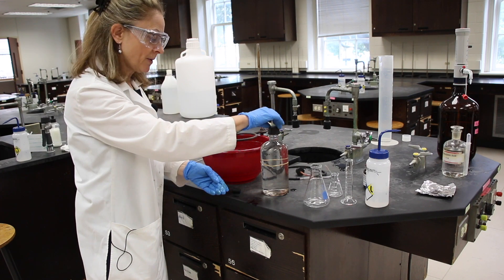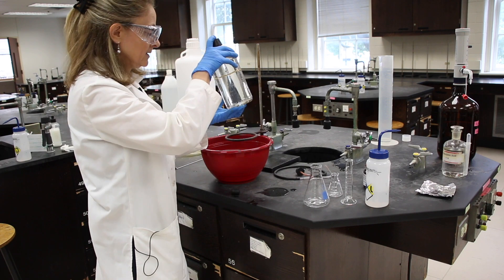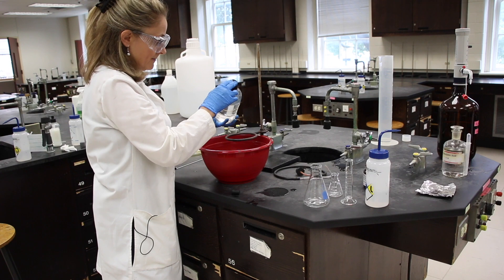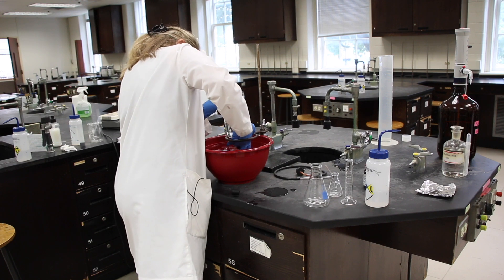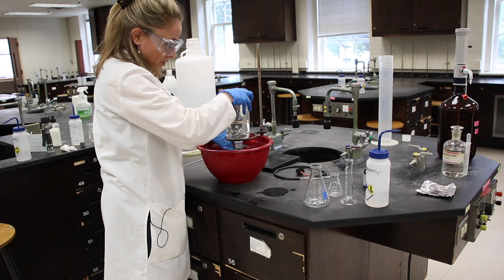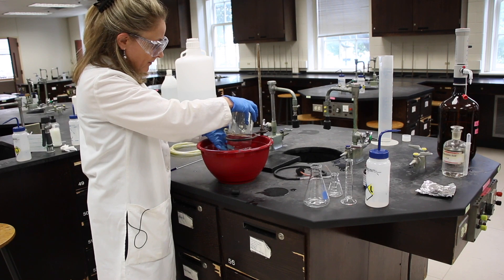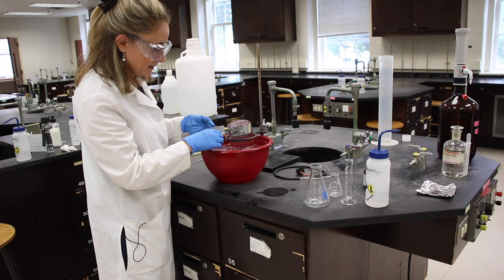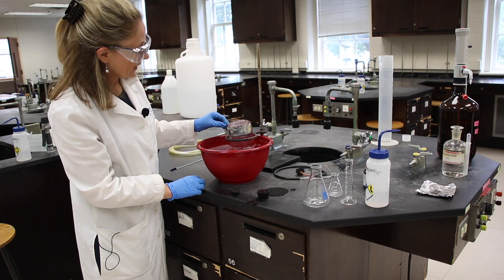This is probably the most tricky part of the procedure, so if you can do this part, the rest is easy. We're going to hold very carefully, very tightly to the stopper, and flip this upside down, and maneuver that bottle through the ring. Once it's in the water, you can remove the stopper.